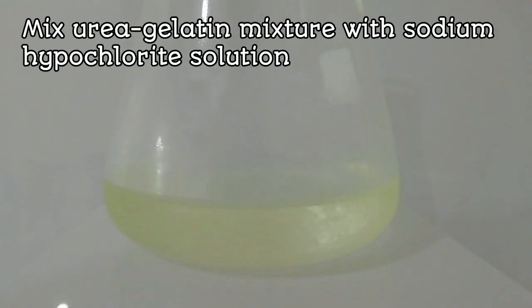Then, the urea solution is directly added to bleach solution at once. This reaction may cause lots of bubble formation.